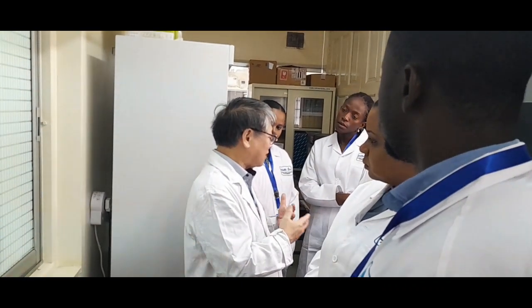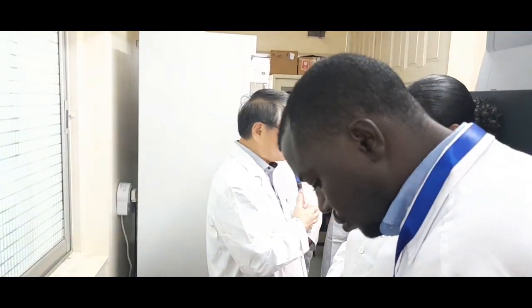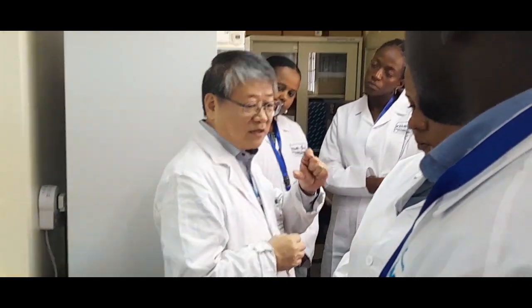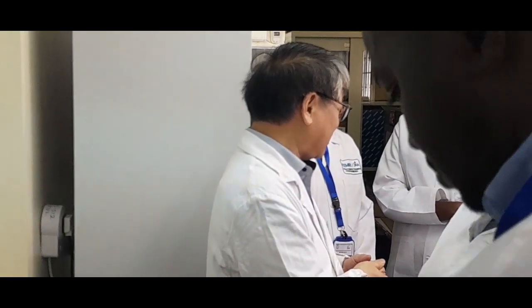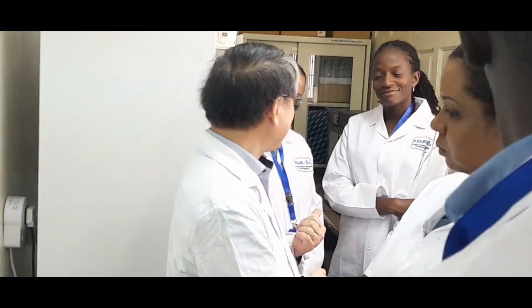Same as with the hybridoma cells, we do the culture, precipitate, and then purify using a protein G column, so that we can get enough monoclonal antibody. So you don't need to use laboratory animals, except for harvesting the splenocytes.